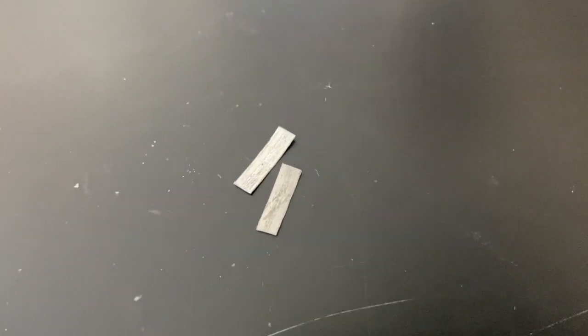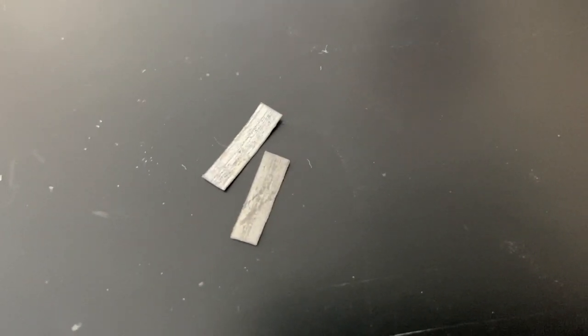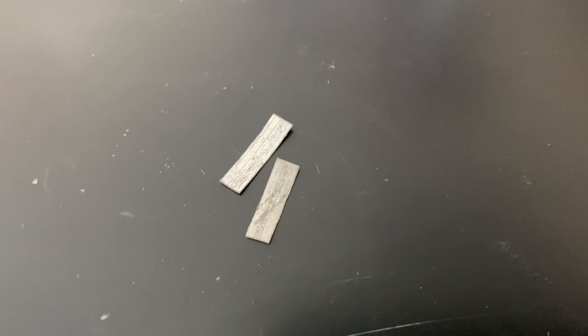For the next demo, you can see we've zoomed in on a piece of magnesium. You can make your observations right now on that.